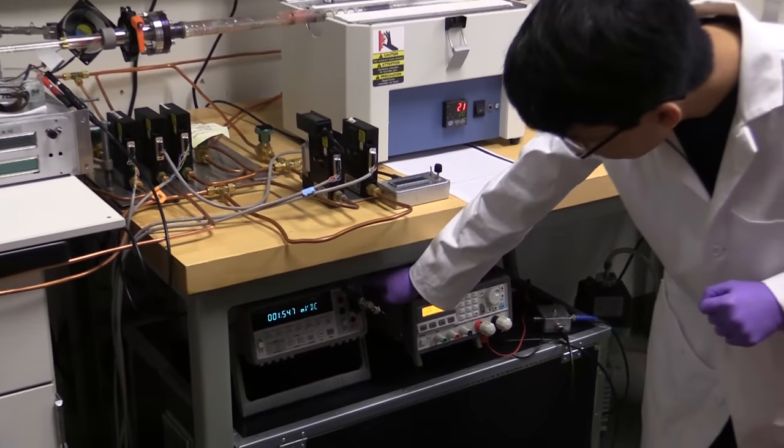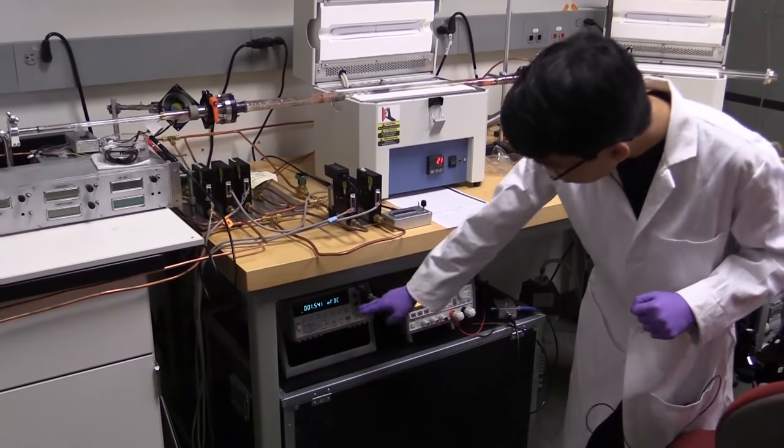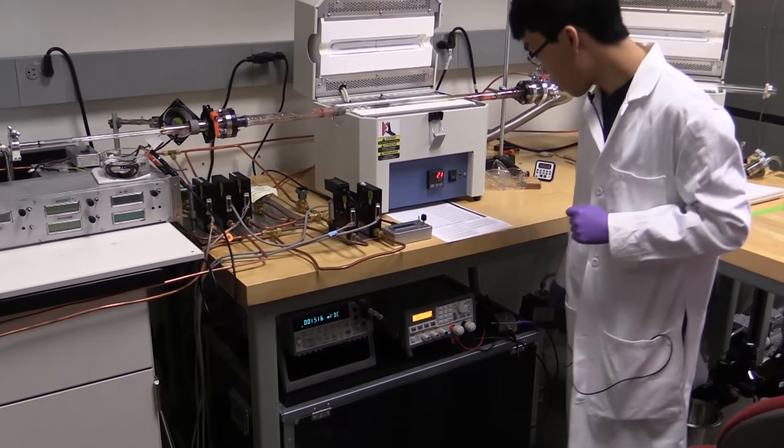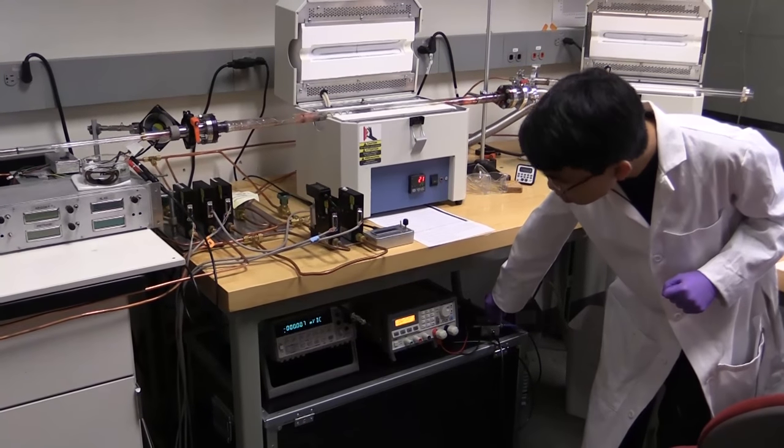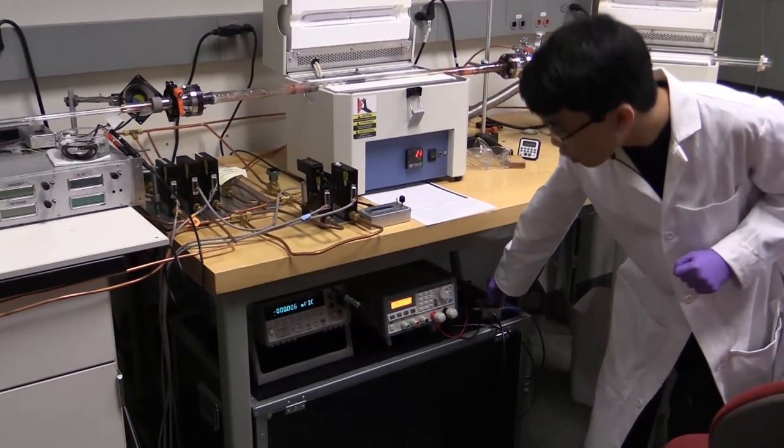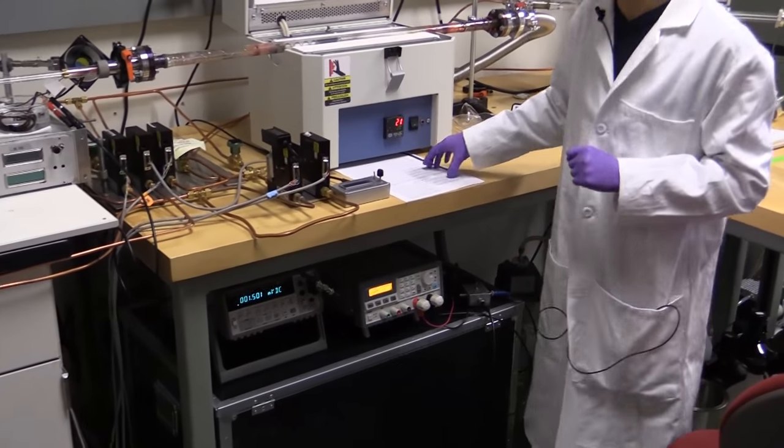Power supply, multimeter. This is, in fact, not reading the thermocouple voltage, but if I go ahead and switch like that, we can get the actual voltage, which I can read off of this table here.